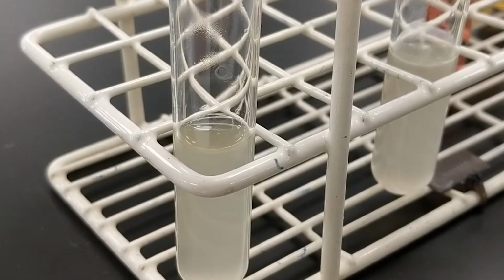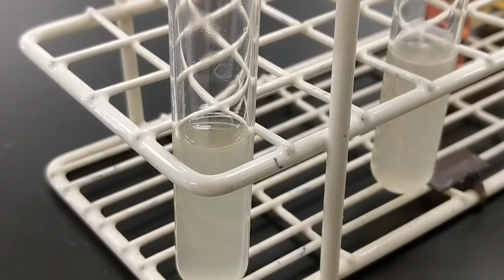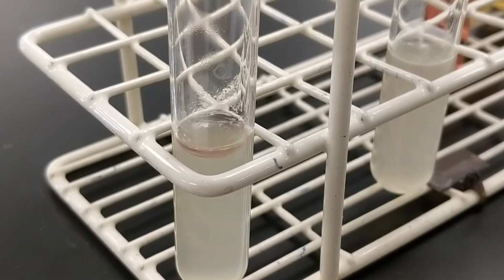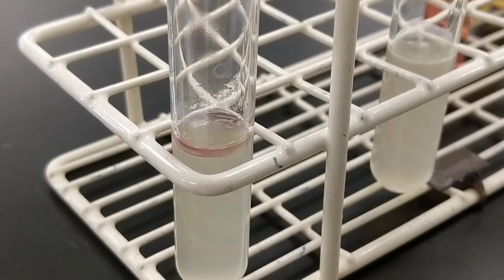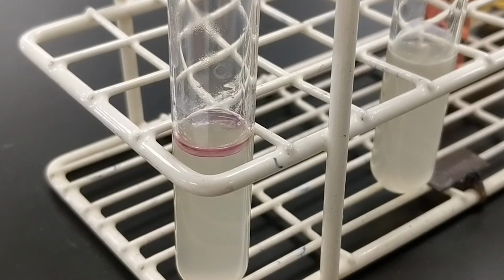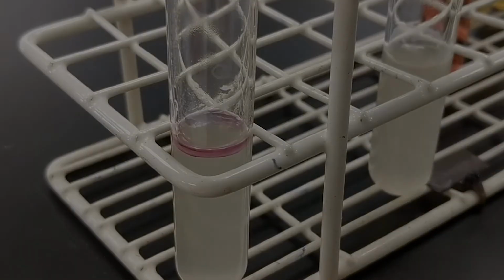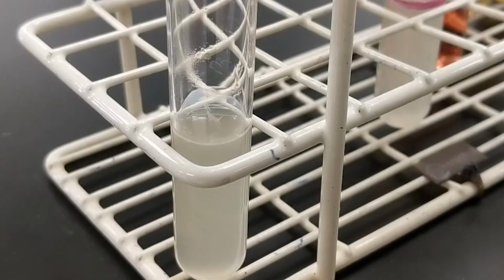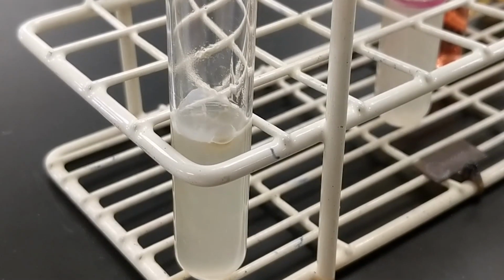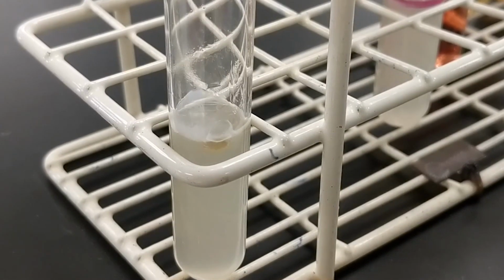This is the Indole test. In the rack in front of us, we have a culture that was incubated for about 24 hours in tryptose broth. I am adding 5 to 10 drops of Kovacs reagent, and as you can tell by that dark red, hot pink color change, we have a positive Indole test, indicating that tryptophan was hydrolyzed by this particular bacterium. I am adding 5 to 10 drops of Kovacs reagent to the broth. There is kind of a tan discoloration, but this is just what the Kovacs reagent looks like. So this would be a negative result.